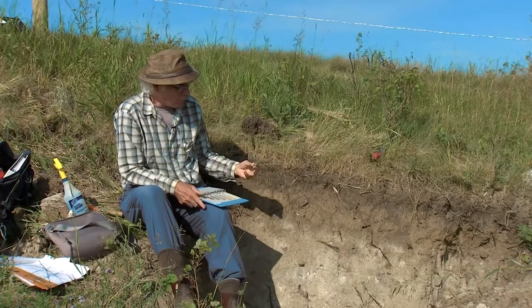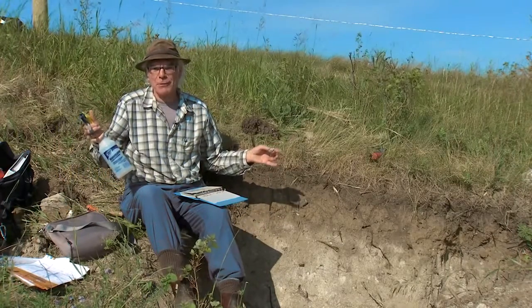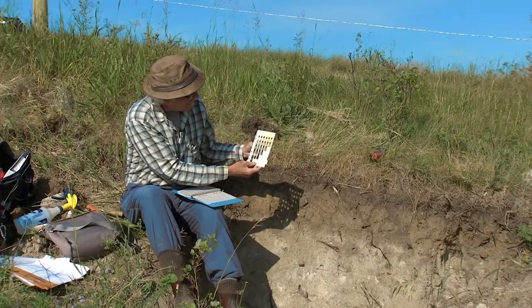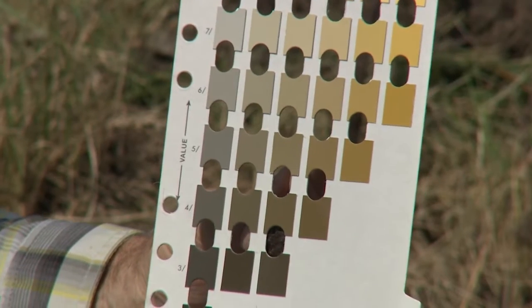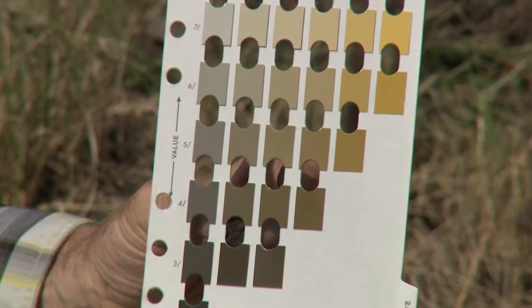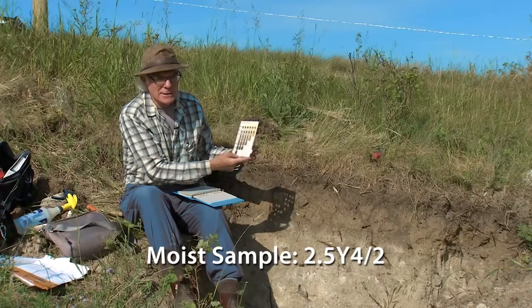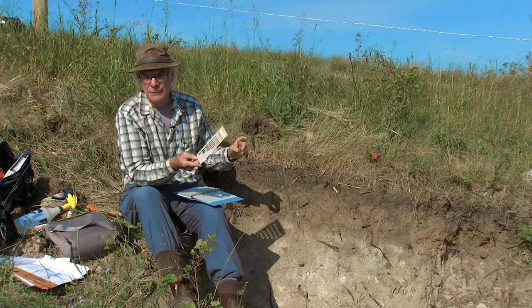Next we want to moisten this sample and do the same color comparison. When you're in the field you can moisten a sample but you can't dry it out very effectively, so sometimes you have to take samples back and allow them to dry for the dry color. I'm adding some moisture here and comparing it to the color chips. Typically what we find is that the value gets darker when we add moisture — the value decreases. This one corresponds to 2.5Y 4/2, so we've decreased by one value unit, which is very typical going from a dry to a moist sample. That's our C horizon.